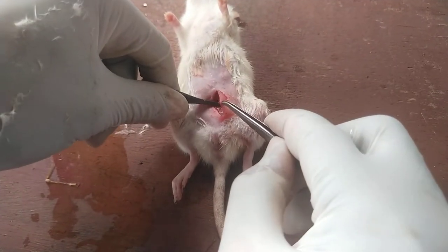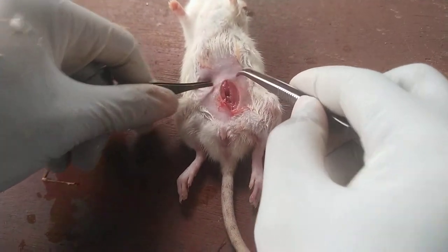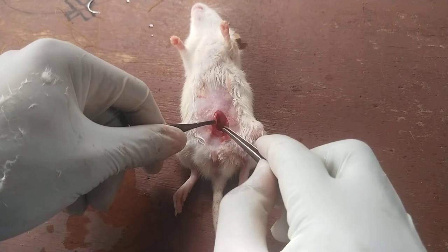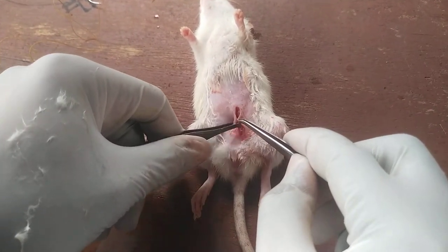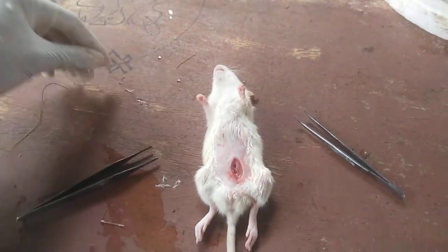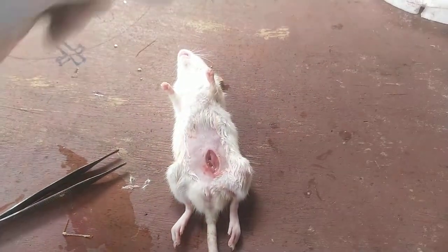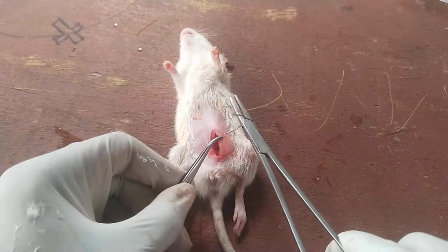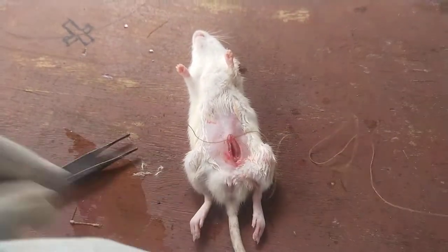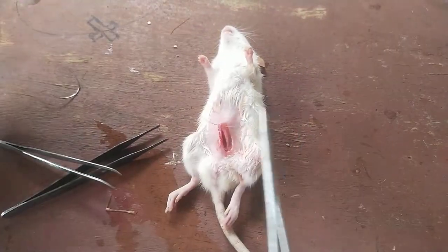The next step is to suture back. First we suture the abdominal muscles, and then we suture the skin. I will show you how we start — we do a simple continuous suture of the muscle layer.